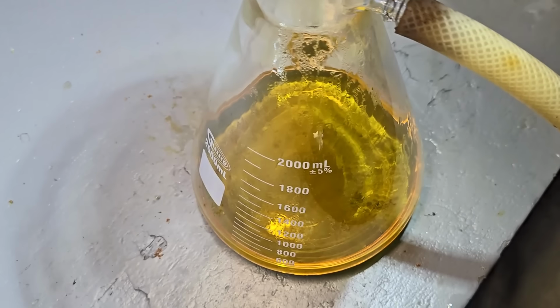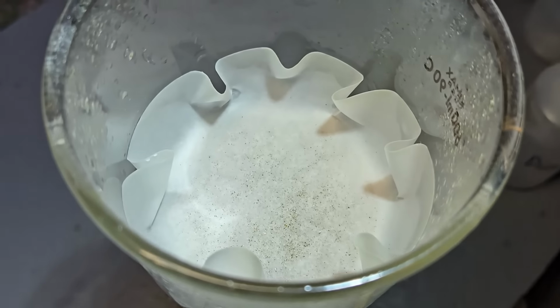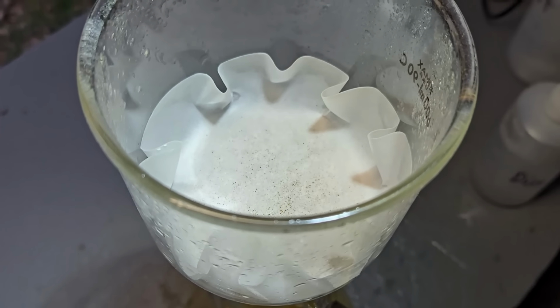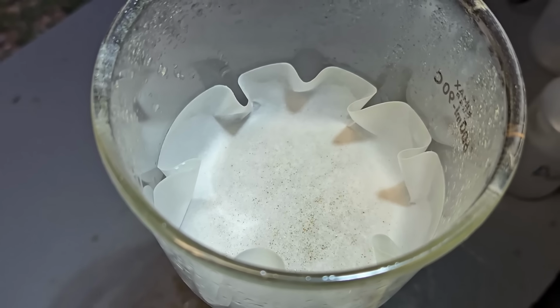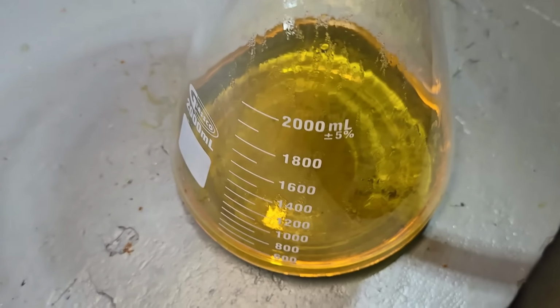Next, I need to denox this stuff. I'm going to mix up my usual solution of sulfamic acid to denox it, and I'm going to run it through this filter, just in case there's any debris in my sulfamic acid. You know, I buy the industrial grade stuff, not the chemical grade stuff. So sometimes there's some debris in it. So we'll run it right through the same filter, and we'll get this stuff denoxed.